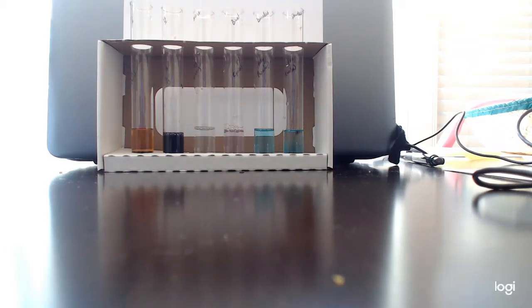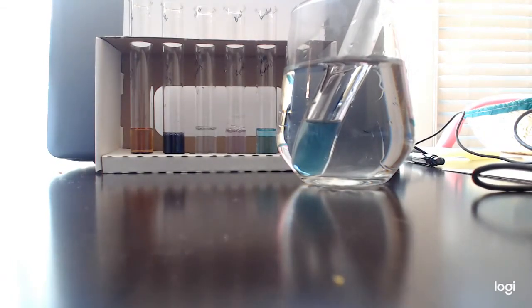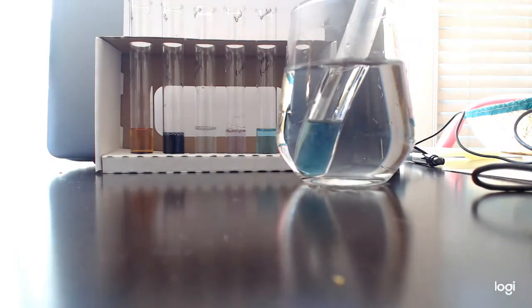Okay, I should heat this up. If I heat this up, it should change color. All right guys, here's what I've done. I got some hot water, I put it into a glass, I put the test tube into it, and hopefully we can see this color change happen in a few minutes. What you should see is that this light blue is going to turn to greeny, orangey, yellowy, and that color change is going to be indicative of the presence of sugars in our solution.